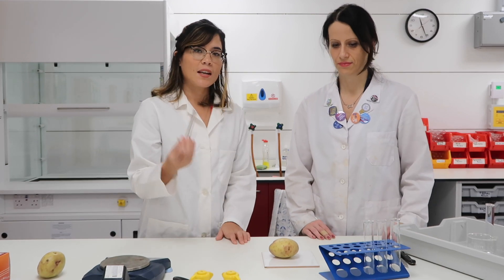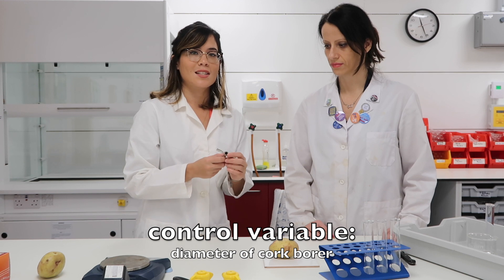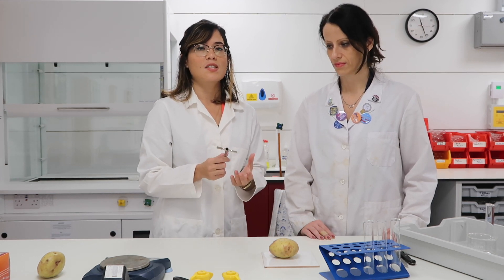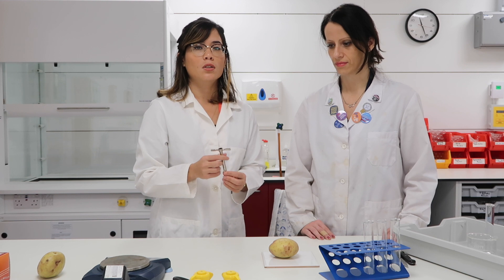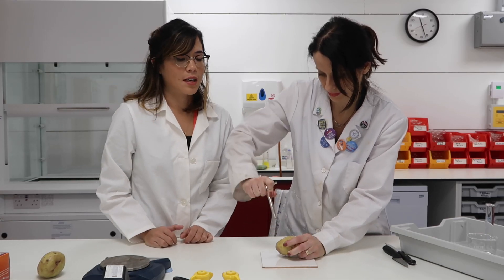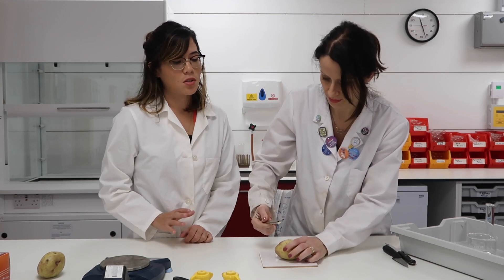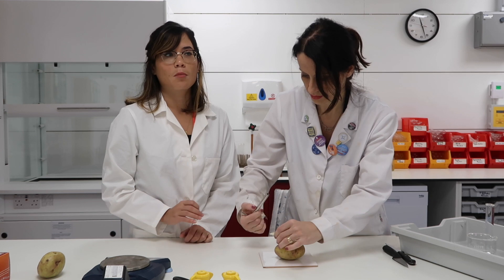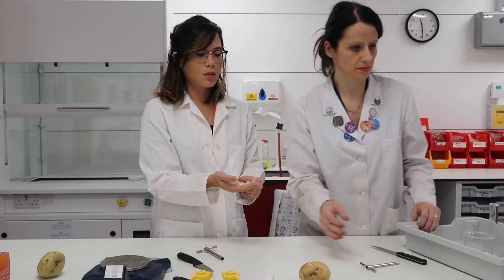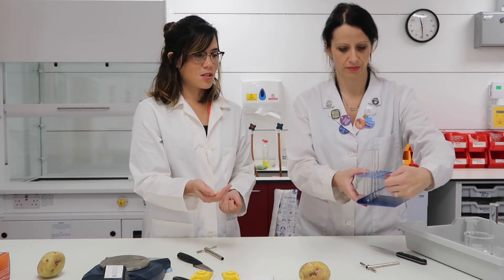When we make our potato cylinders, make sure as a control variable you're using the same cork borer. That's essential because by altering the surface area you'll alter the water movement. Notice that the potato cylinders are all coming out of the same potato. You might need to use multiple potatoes, but make sure they're the same variety. Now we have our three identical cylinders ready to be placed in their various solutions.